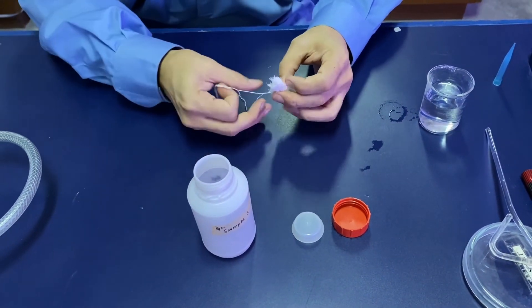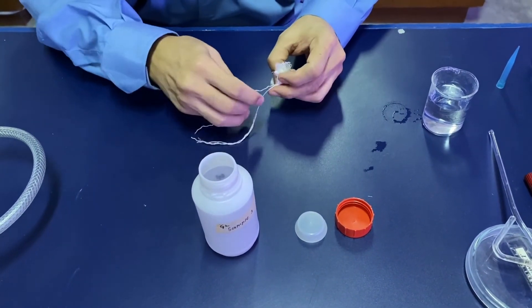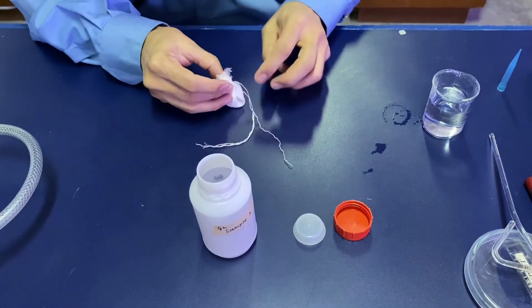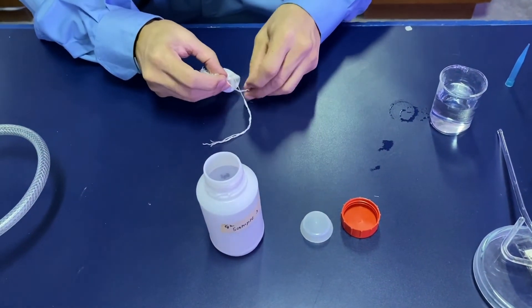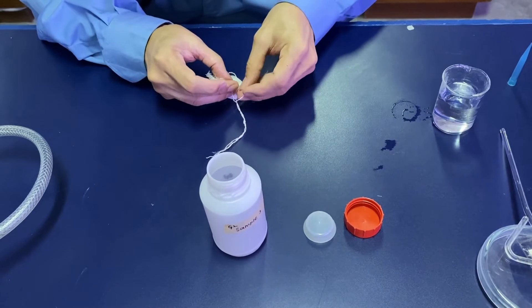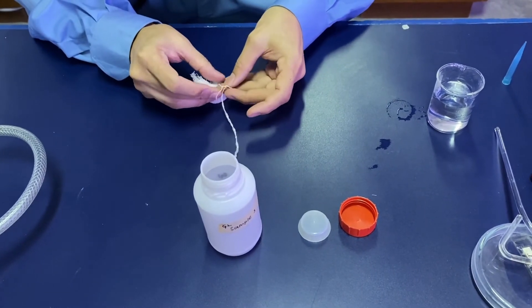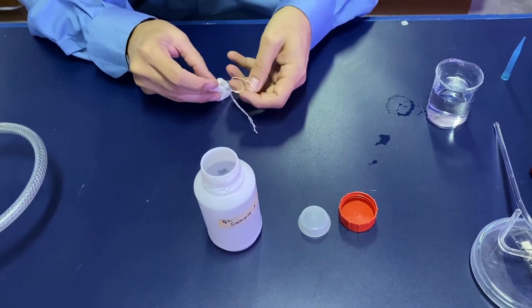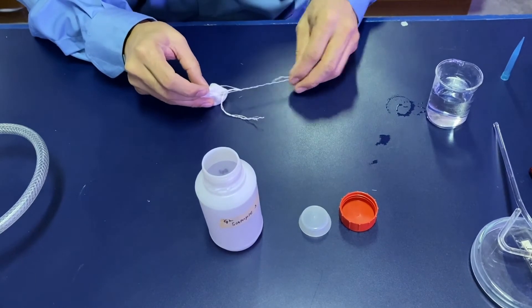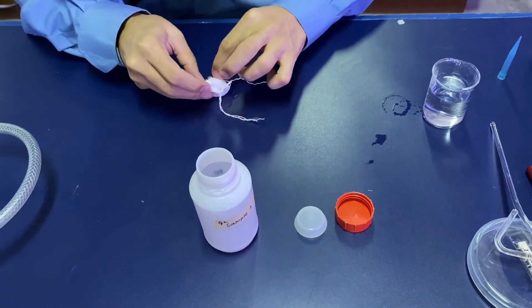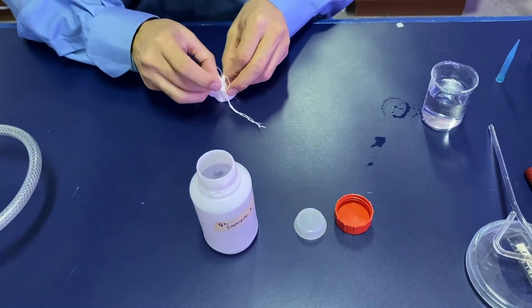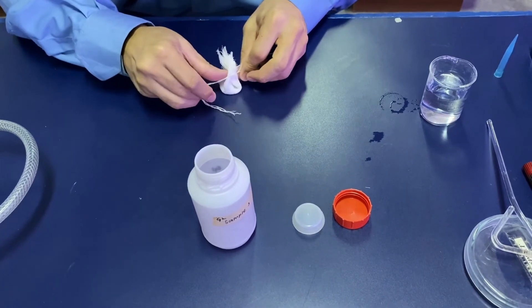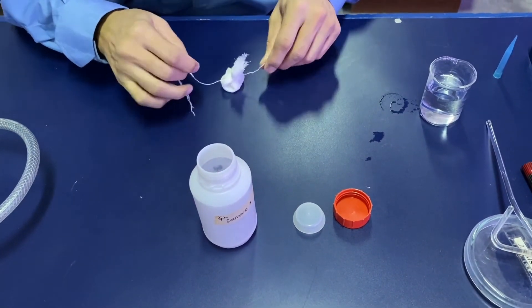Use a piece of string to tie up the soil. When you're doing this soil experiment, we usually do it with a control.